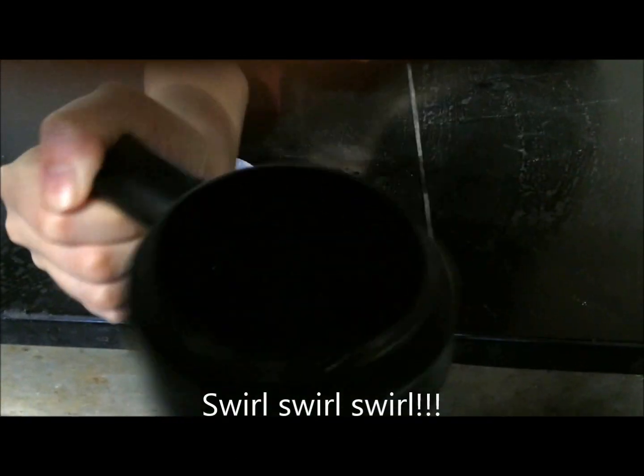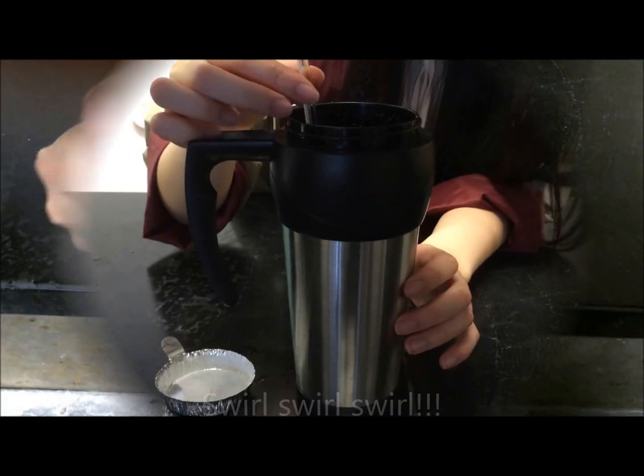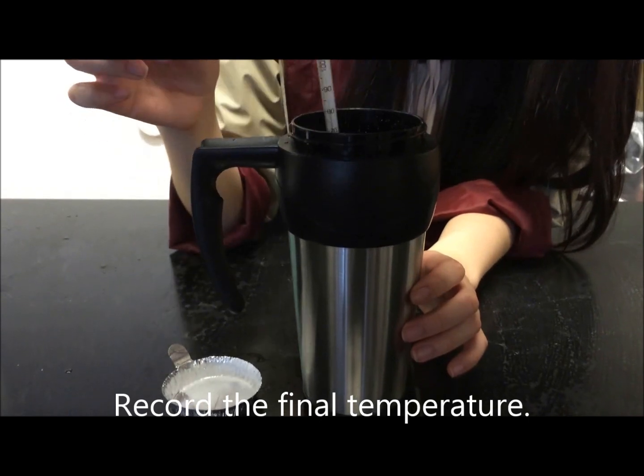Swirl, swirl, swirl! Record the final temperature.